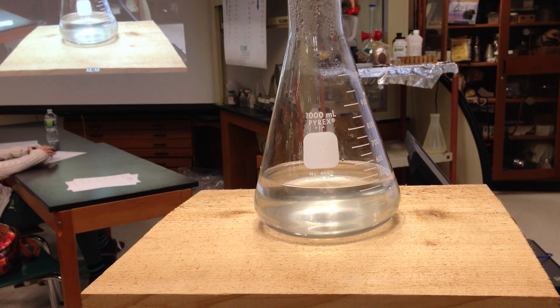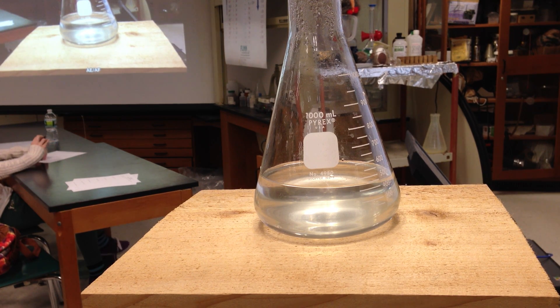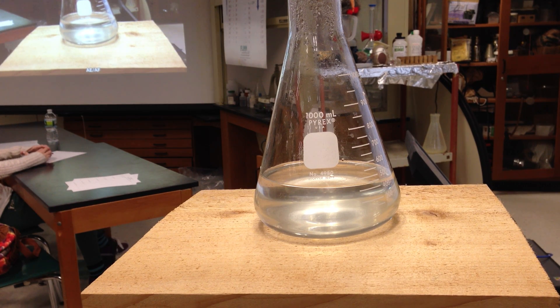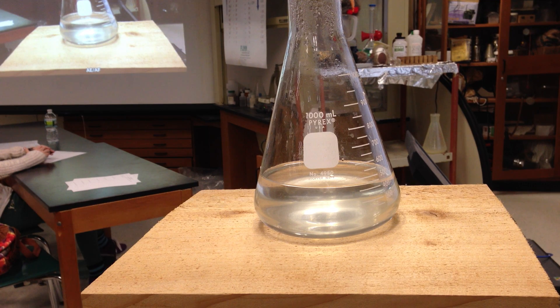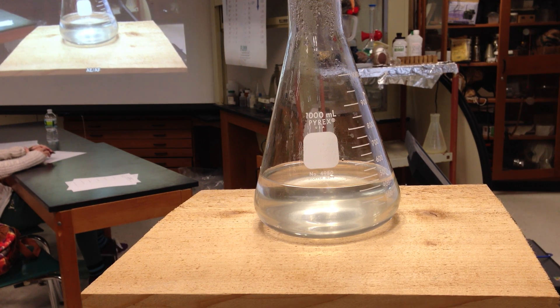And what I did is I cooled this gently. So as the solubility curve dropped, the amount that should be able to dissolve by the solvent of water has decreased substantially, and you'll see how much it decreased.